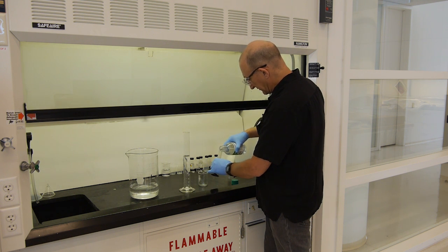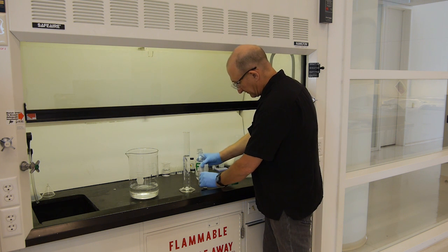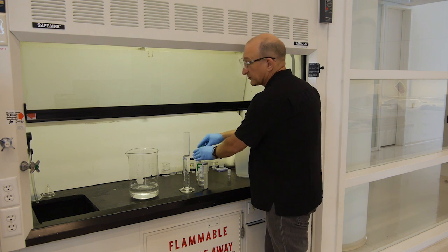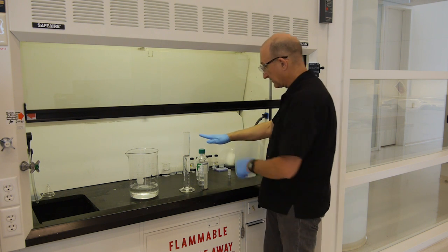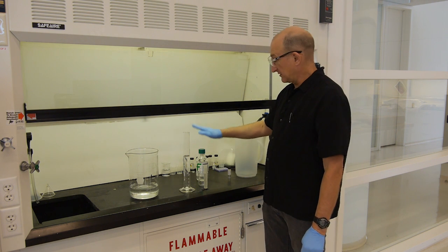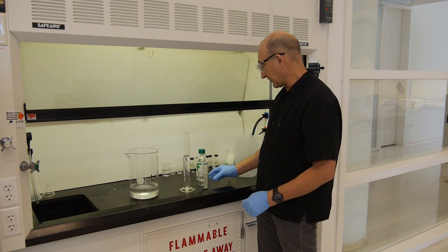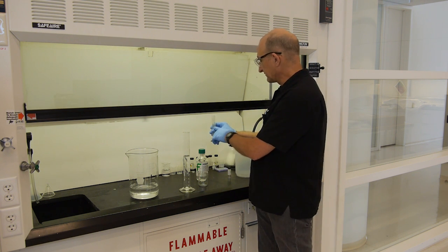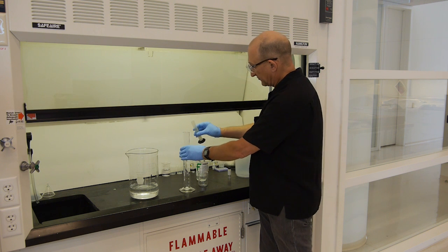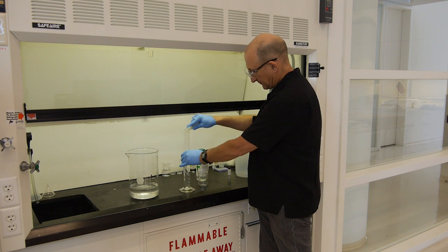We're going to use 10% ammonium hydroxide to neutralize. And in that case, what I mean is 10% of what's in the bottle to water, not 10% ammonia gas in water. So this is 20 milliliters to a final volume of 200.